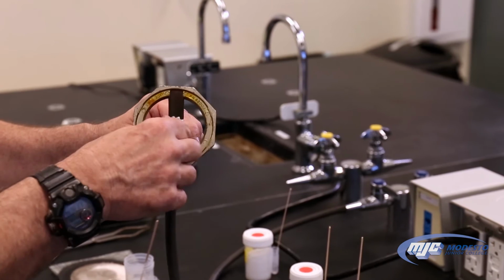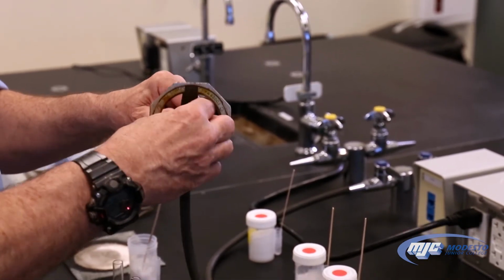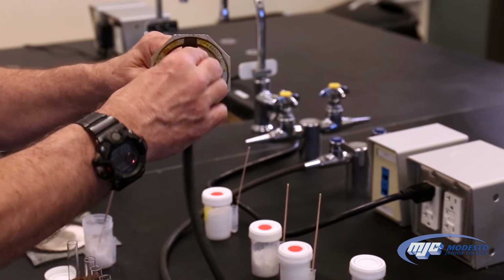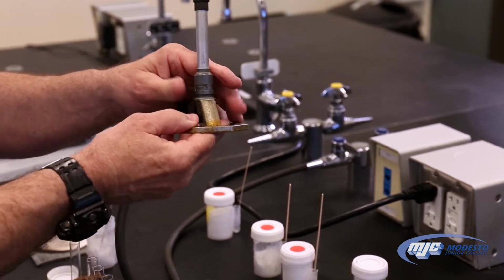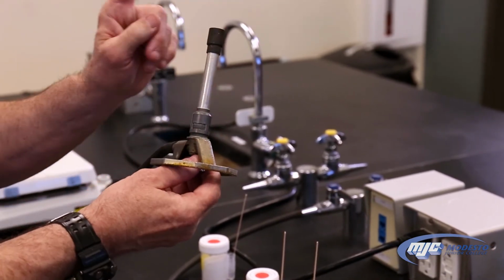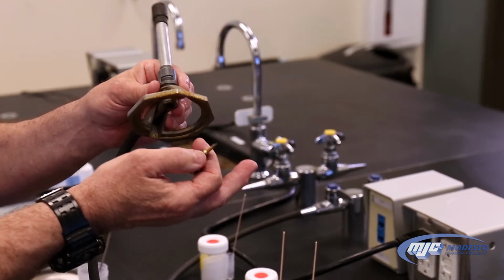The next control is on the bottom of the Bunsen burner. There's this little knurled handle. This is a needle valve. And what this does is this controls how much of the fuel gets to the flame. The only thing we have to be careful about with this is, if we back this out too far, it will come all the way out. And the problem is that if the flame is lit and you're adjusting this and it comes out, now flames are shooting out and you can burn your hand.